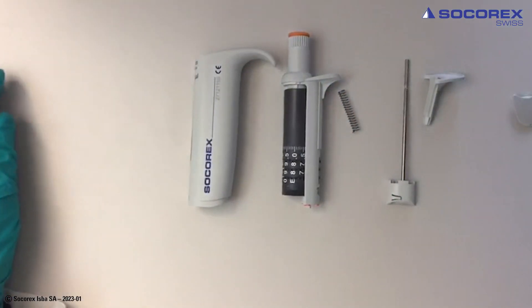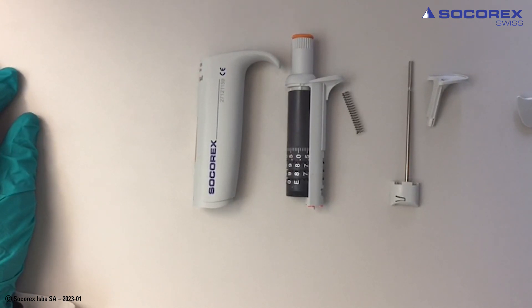If any need for a change, change the complete counter assembly.